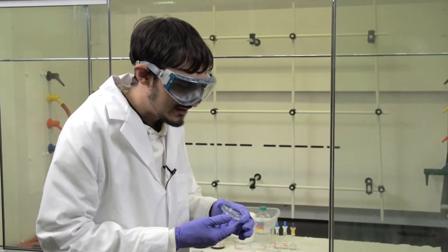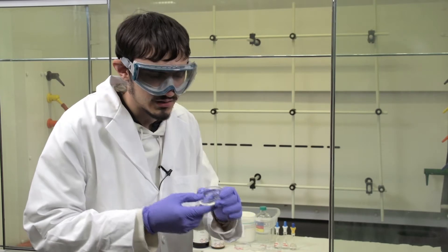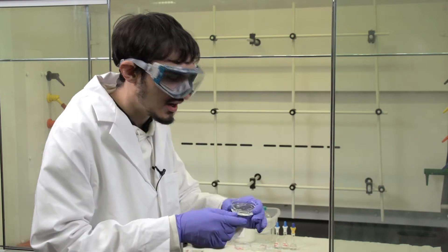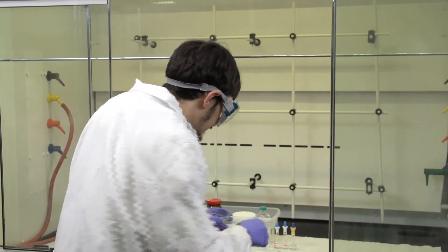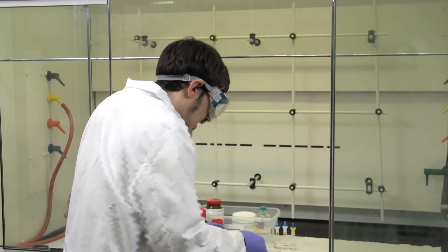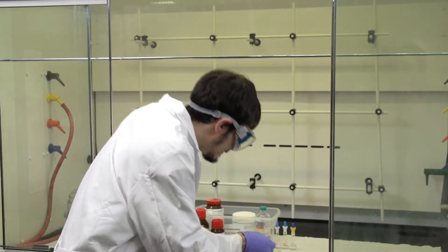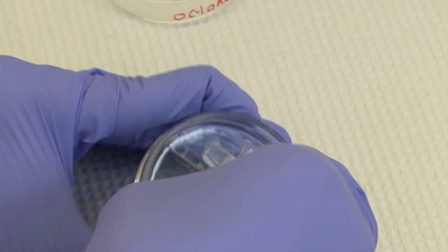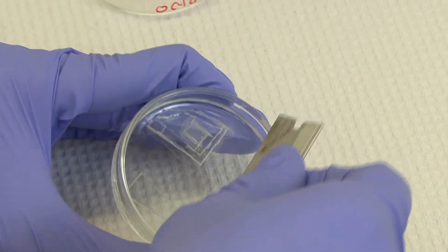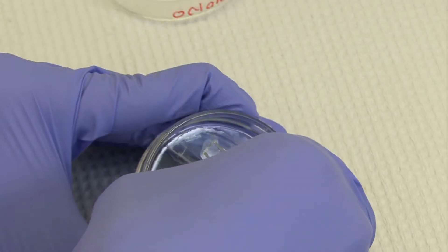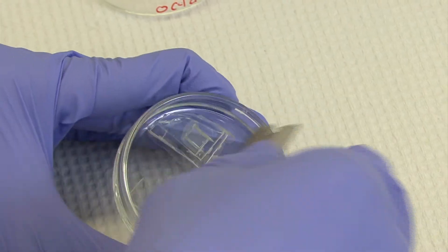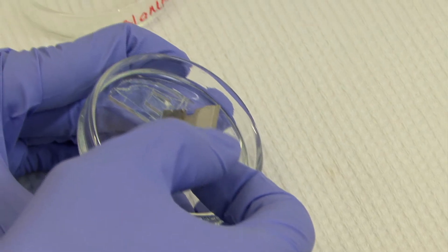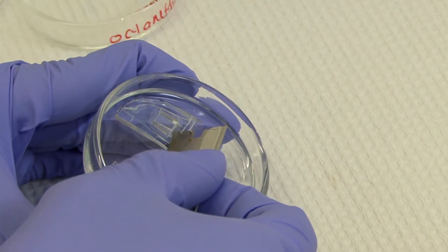Now that you've obtained the polymer back from the oven and it's been cured, you'll want to cut out the individual stamps that you'll be using. Obtain a razor blade and make long but deep cuts in the polymer. Notice that I'm not cutting on the edge of where the CD is but within the center.